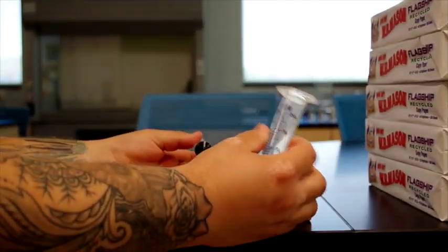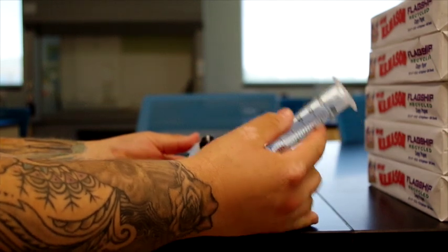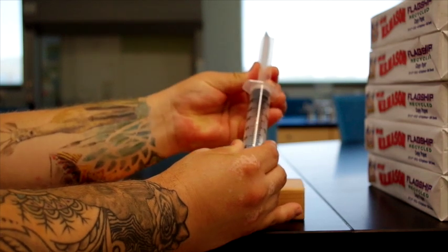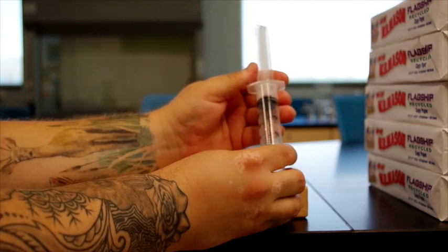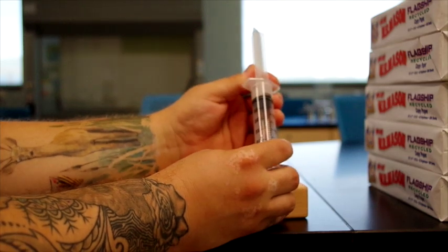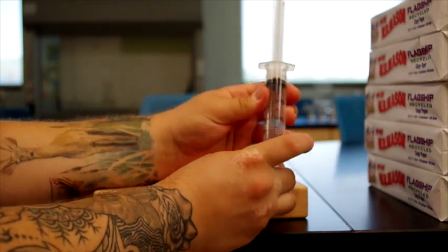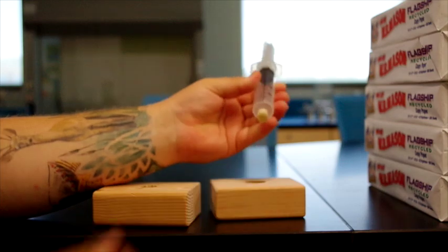Once we have measured the diameter of the syringe, we need to take the plunger and put it into the syringe at exactly 30 milliliters, which will be our starting point, and the bottom of the syringe will be at the 30 milliliter mark. Now that is placed, we put the cap on the bottom to hold it. This seals the pressure inside.